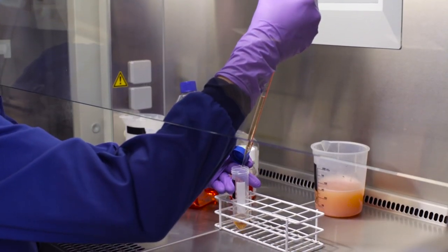Remove the supernatant using a sterile serological pipette and resuspend the cell pellet with 37 degrees Celsius serum containing growth media to the original volume of the starting culture.